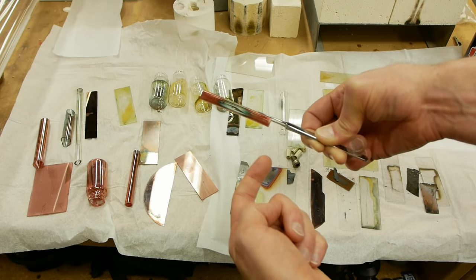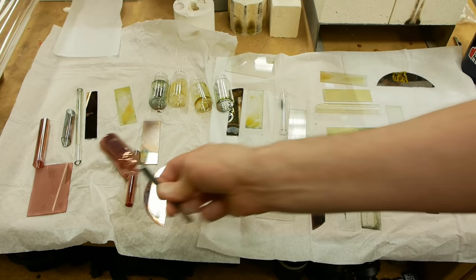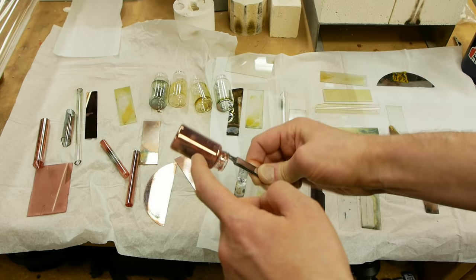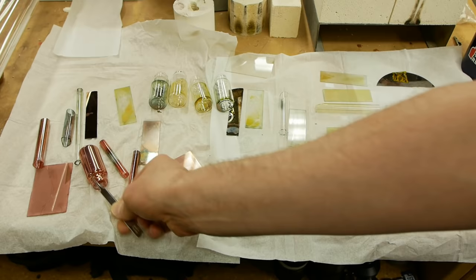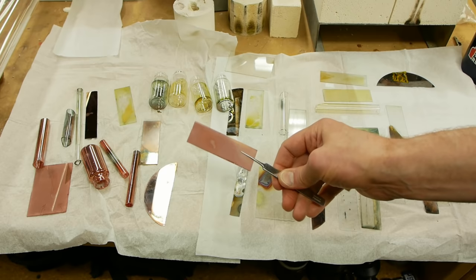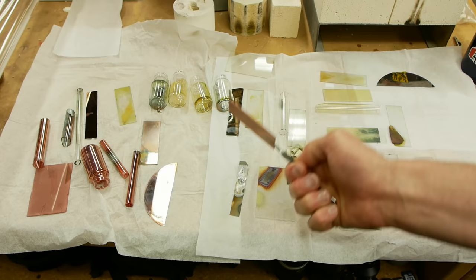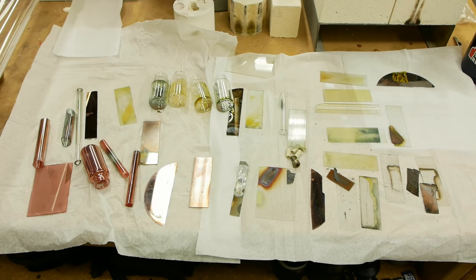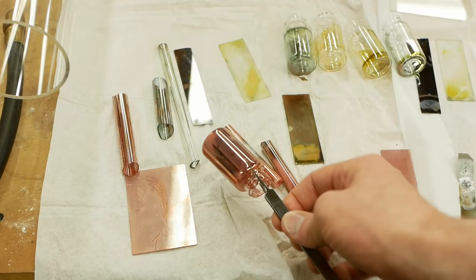But as you can see, you don't need expensive lab equipment to tell that this is not evenly coated. There's way more copper on the ends here than in the middle. And similarly, on the glass bottle, it's a little bit more uniform, but you can clearly see through the glass at the neck of the bottle. And even down here, it's definitely not uniform. So what's the deal? Taking academic papers and trying to make them work in the real world is kind of what's fun about this and figuring out where the imperfections are. So clearly there is some technique involved. The system doesn't work perfectly all by itself.